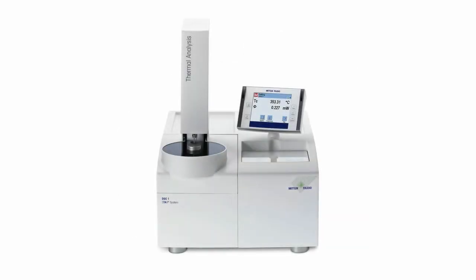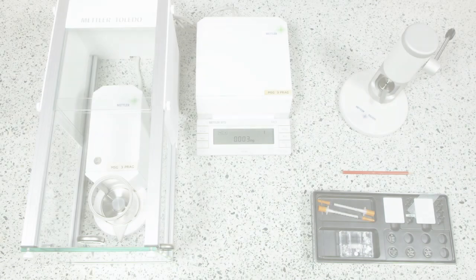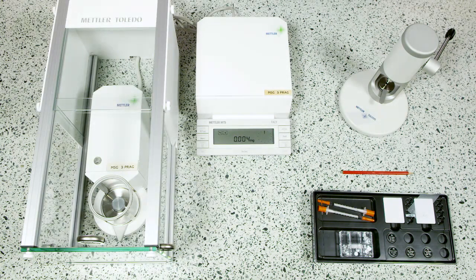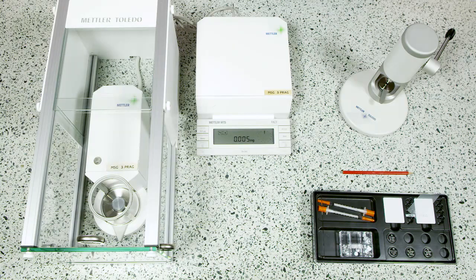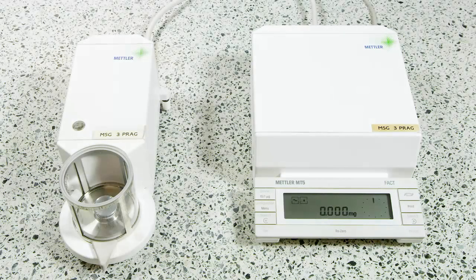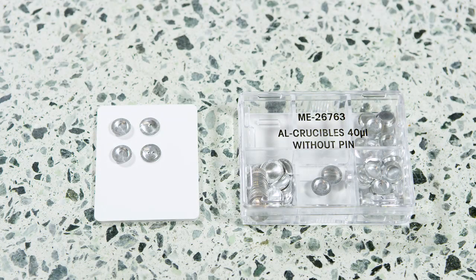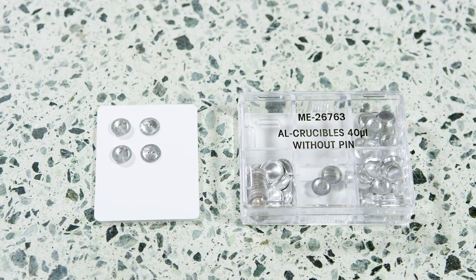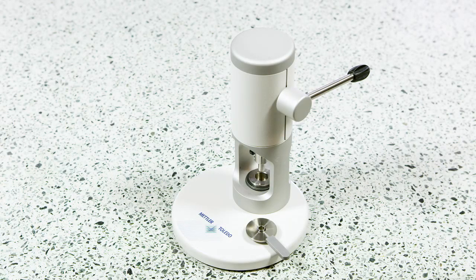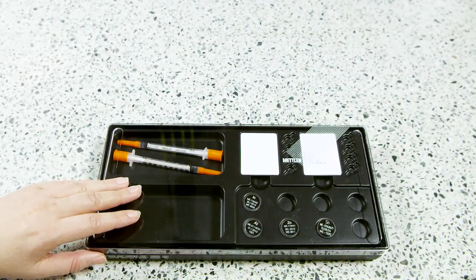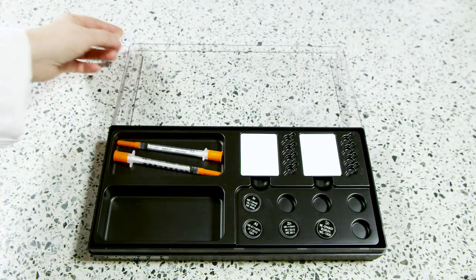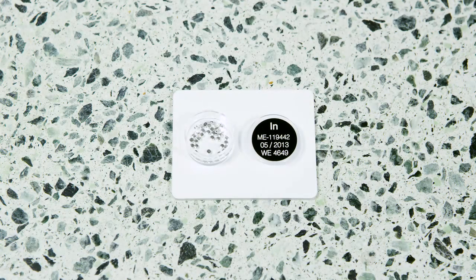We will now demonstrate how to do a standard calibration on a DSC. For a DSC calibration, you need the following accessories: a microbalance placed on a stone table, two standard 40 microliter crucibles with pierced lids, a crucible sealing press, the calibration toolbox, and suitable calibration material.